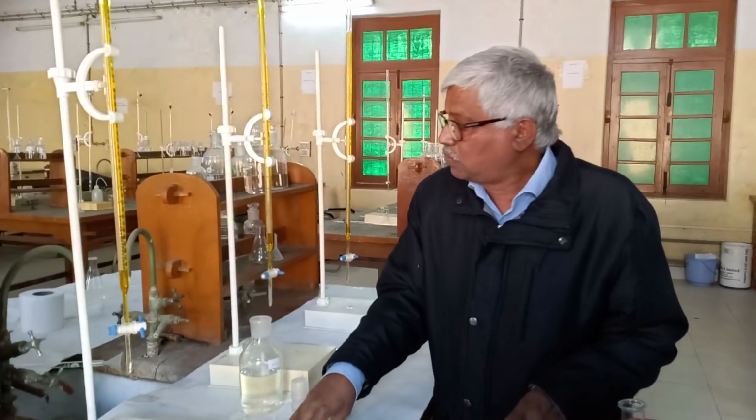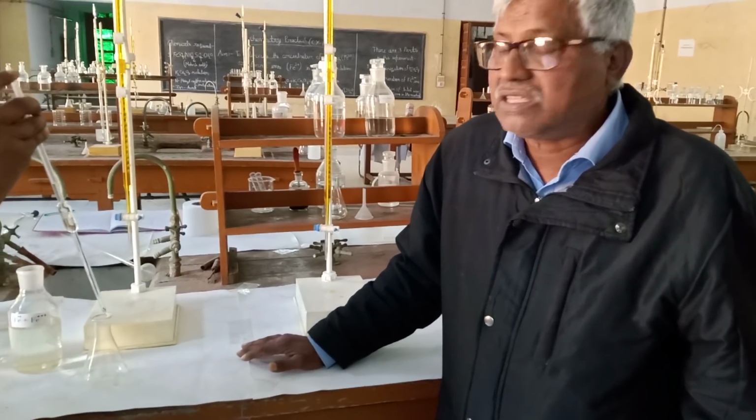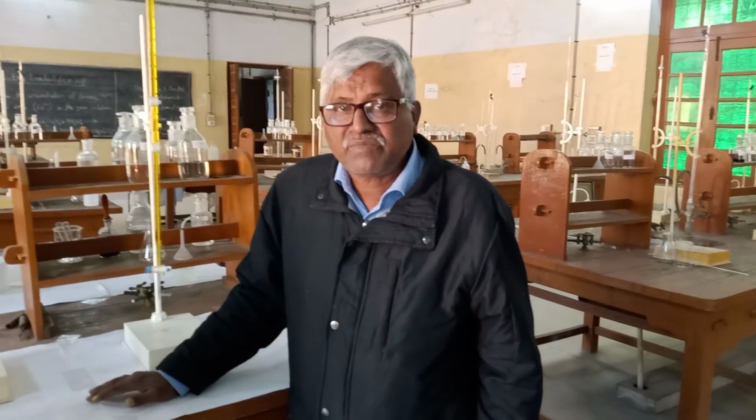Now you come to the second part of the experiment, the determination of ferrous ion in the mixture.